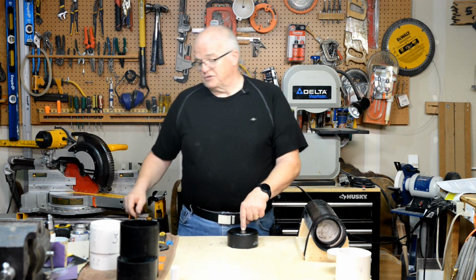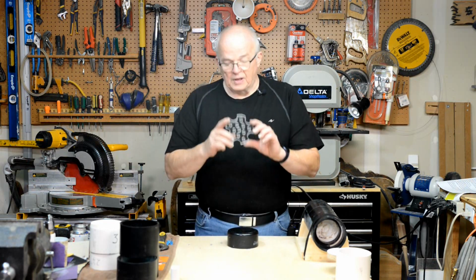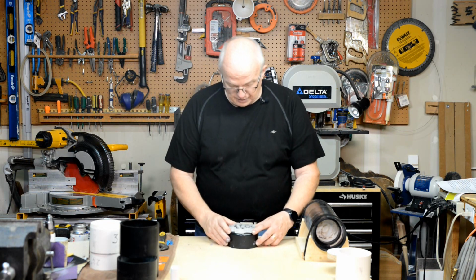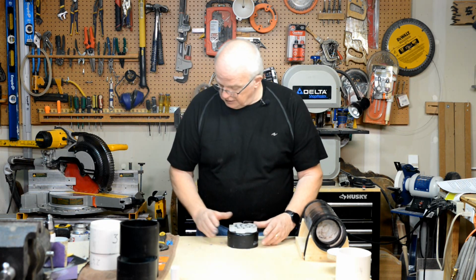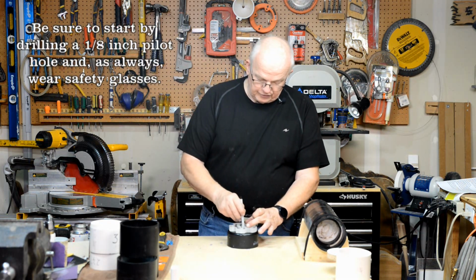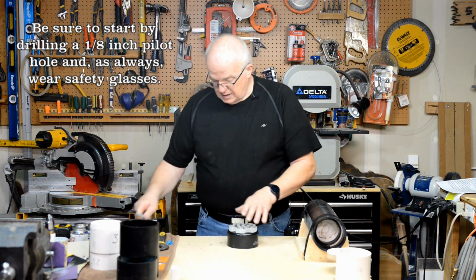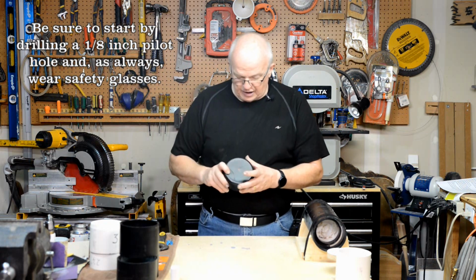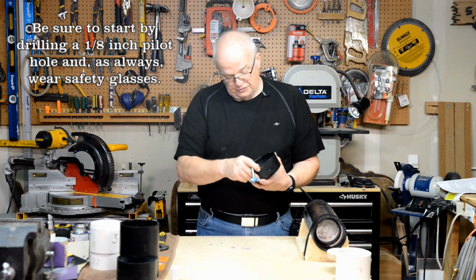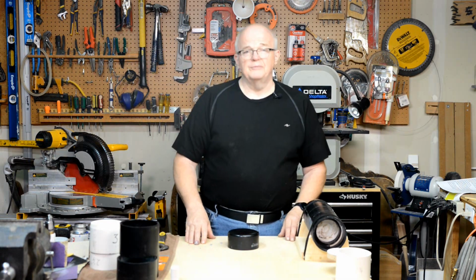The center doesn't have to be exact, but I found an easy way to figure out what the center is. I've taken this vented piece that you did in the prefab. I'll lay it on there, and there should be a hole right smack in the middle of that. And so I'll lay that in there, center. I'll use this marker, and there I have my center. And I will drill this right there, and it'll go all the way through the acrylic, and we'll move on from there. Okay?